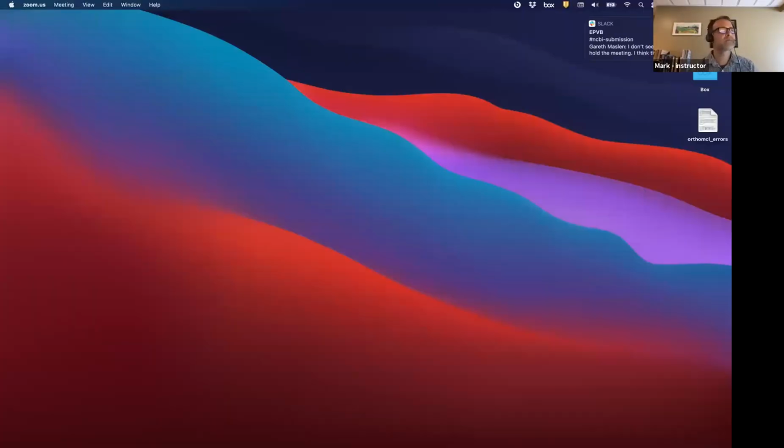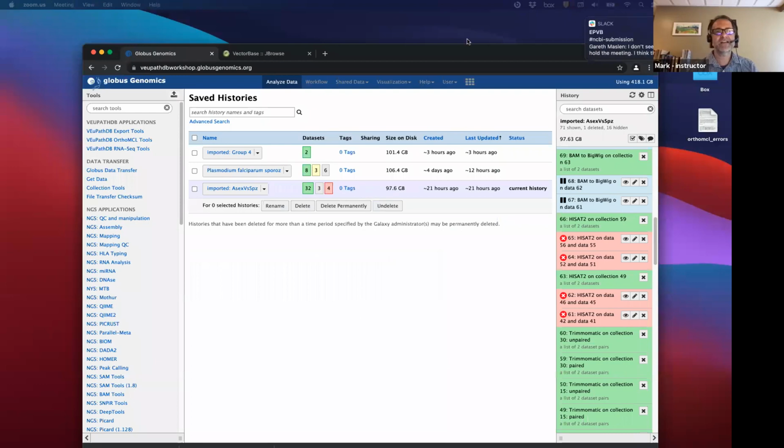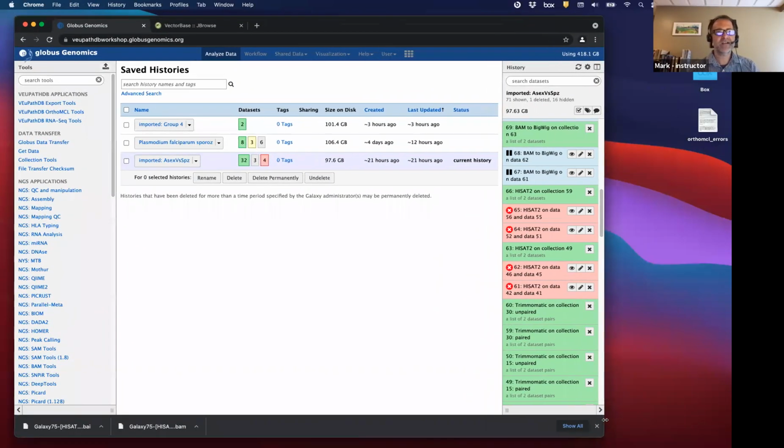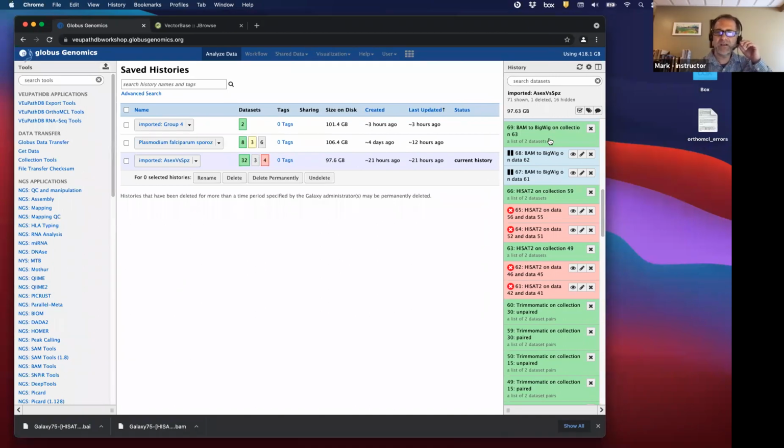Show you right now what to do. Okay. We'll go through the practicalities of and revisit some of the theory in Galaxy. But here's your workflow, and you can see there's a lot of failed steps. This is from our group.